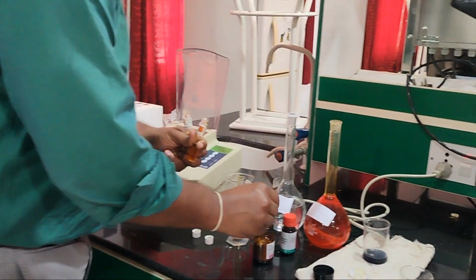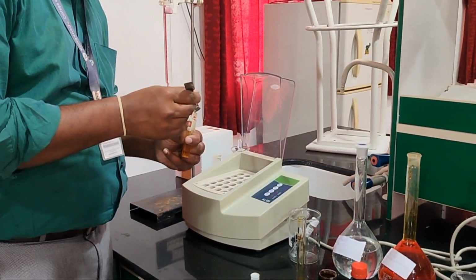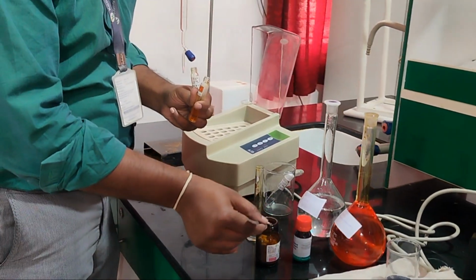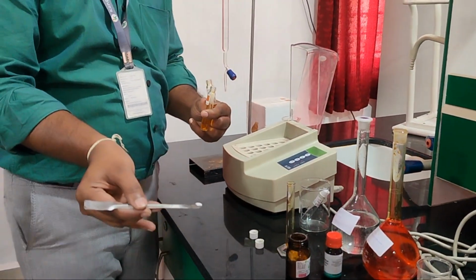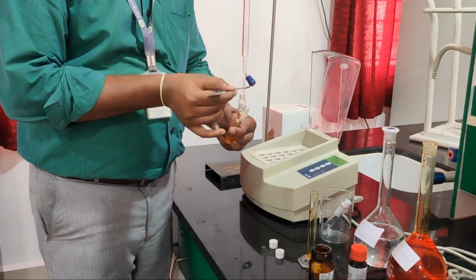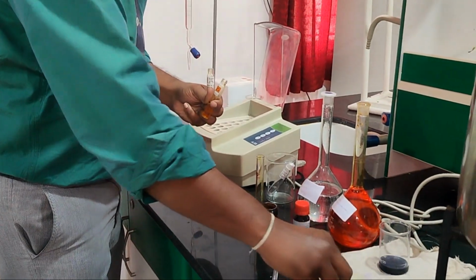So now this is the pinch for both the samples.